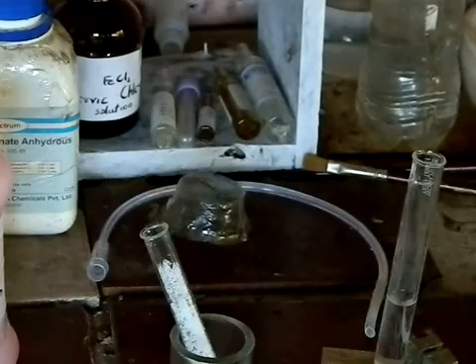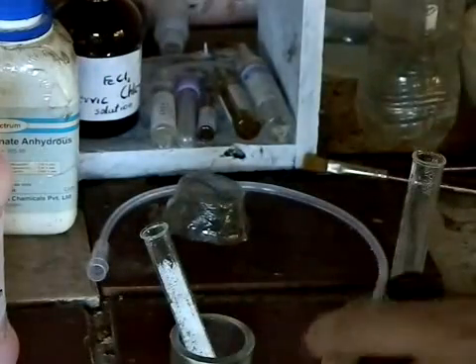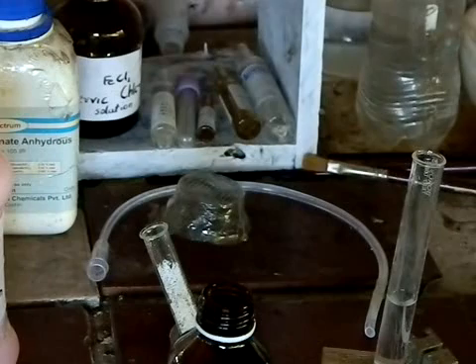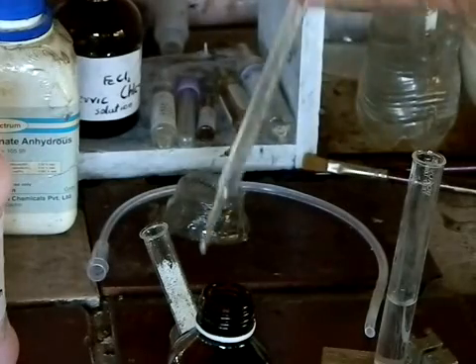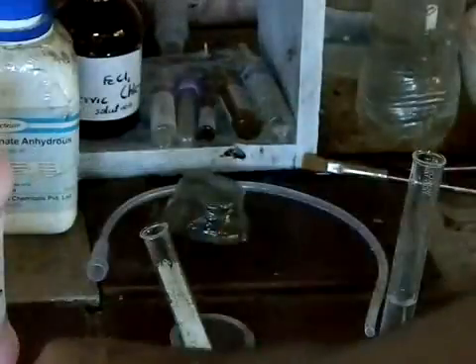You will have to do it pretty fast. This is some dilute hydrochloric acid. While doing this, extreme precautions must be taken — as even though the acid is dilute, you have to be cautious of the chemical present in it. I will be using another dropper to take out a little hydrochloric acid.